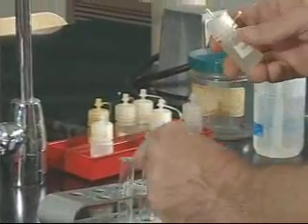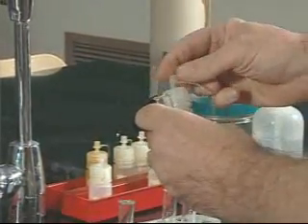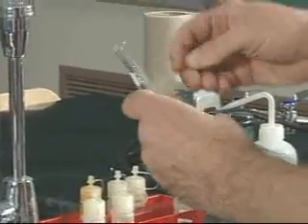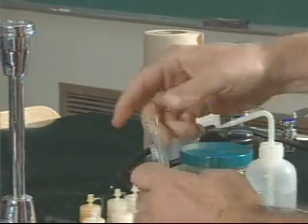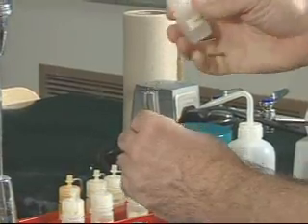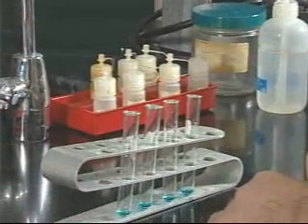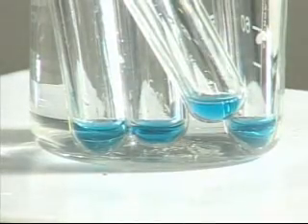Add three drops of the second standard to the second tube and swirl to mix. Add standard three to the third tube and swirl to mix. And finally add the last standard to the last tube and swirl to mix. Now we place all four standard tubes into the water bath and let them heat for five to ten minutes until a color change occurs.